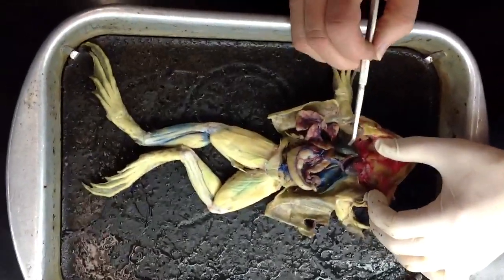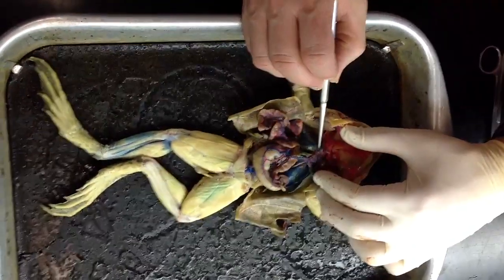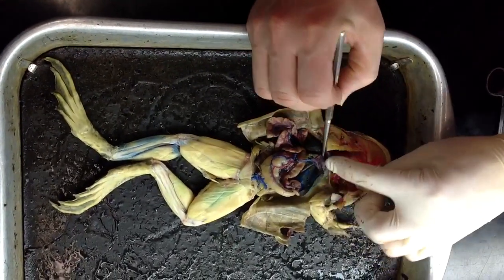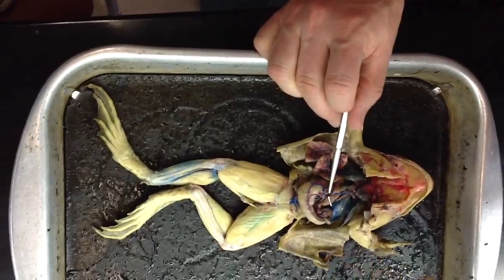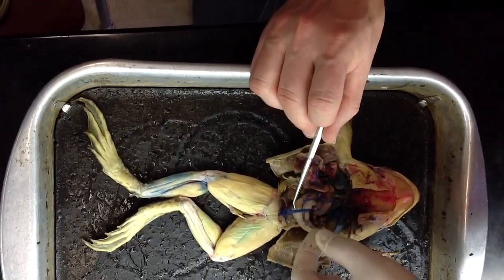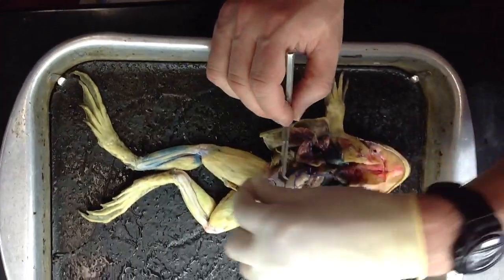This one we can't see the anterior vena cava, but they're usually lumps right up in this area. And I can see some dark areas right in here where the anterior vena cava are, here and right over in here. Ventral abdominal vein sits right on top of all the viscera here, and it continues on as this vein. You can see where they connected. This one is formed by the union of the two pelvic veins.